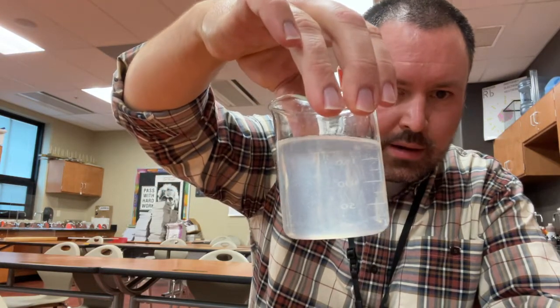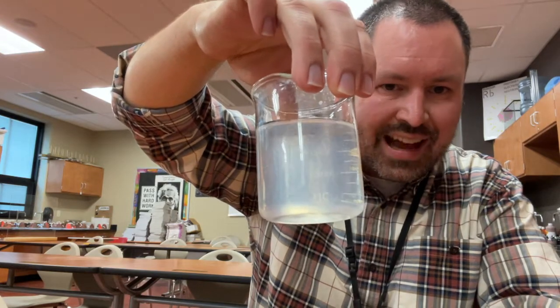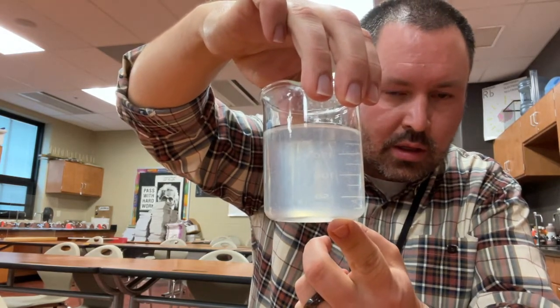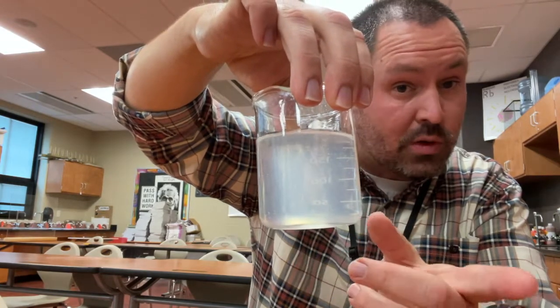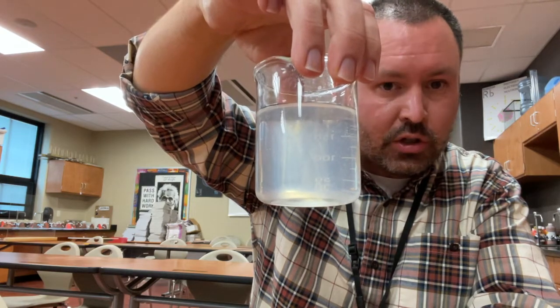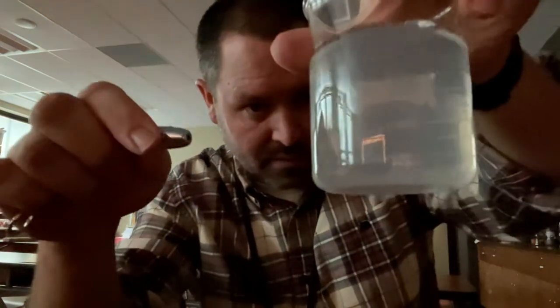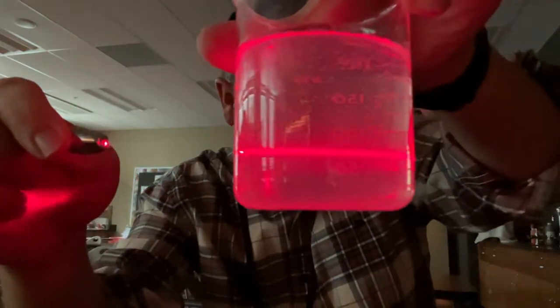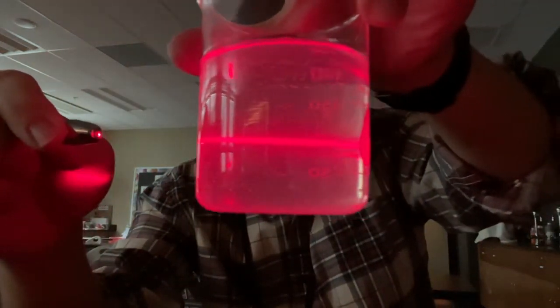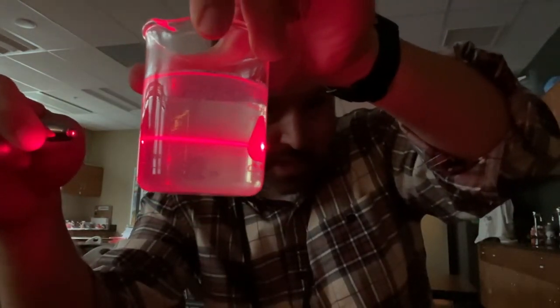What can you note about its appearance? By the way, one thing that you should note is I have not stirred this for a long time. I have not stirred it for 24 hours, in fact. So this is the starch and water. It has been unstirred for 24 hours. That's going to give you a clue as to what it is. This next one is the starch in the water. Let's see if this shows the Tyndall effect. Can you see a laser beam in there? Is it scattering light? You tell me, can you see the Tyndall effect in here? Is the laser beam scattering light?